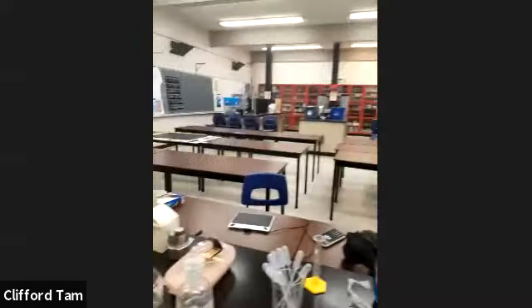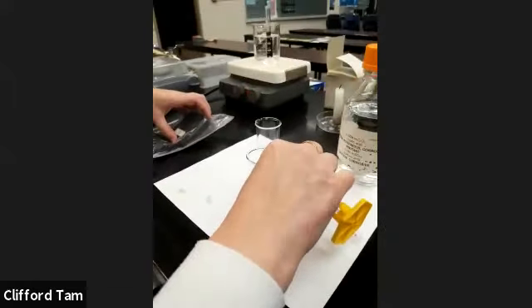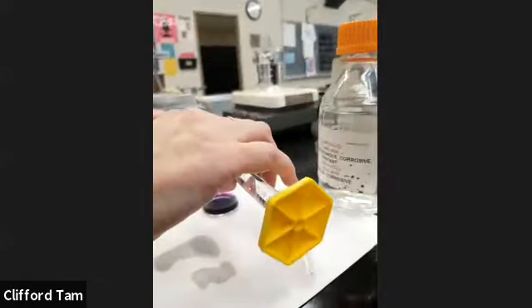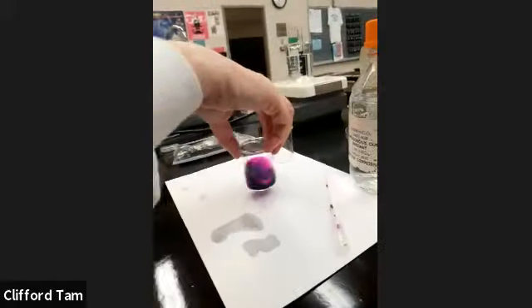All right, guys, so we're back with temperatures. Xantha's going to mix these two solutions together: the oxalic acid with the potassium permanganate. Okay, and we're going to start a timer. And now we're going to see what the effect of temperature is.